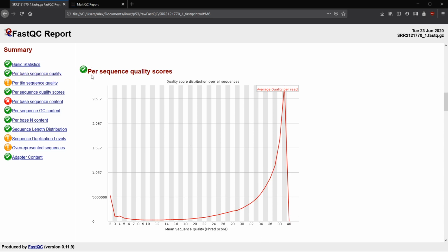A warning here is going to happen when the average quality drops below 27. So if this was the average or less, we would see a warning for this. But a failure is going to happen if we have an average quality of 20 or less. So this is a cumulative reads. We have an average of 20 or less. We're going to have this be a failed quality check.